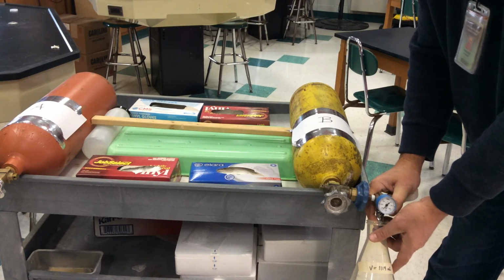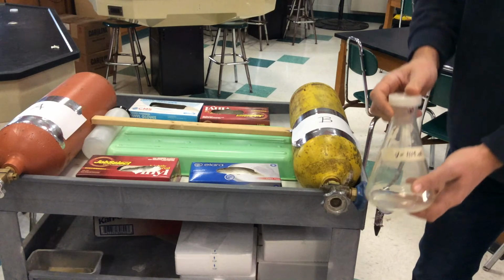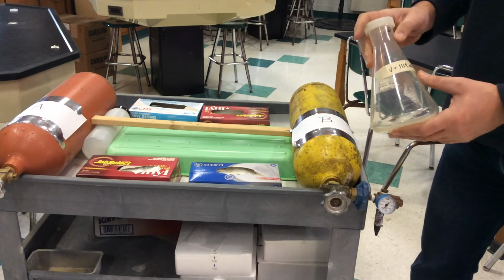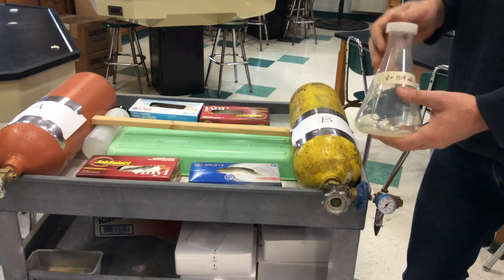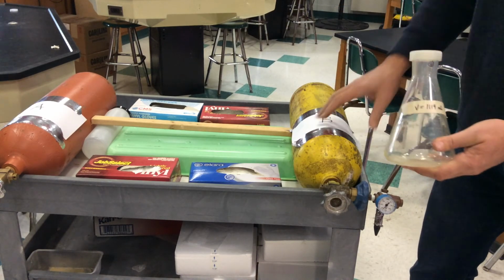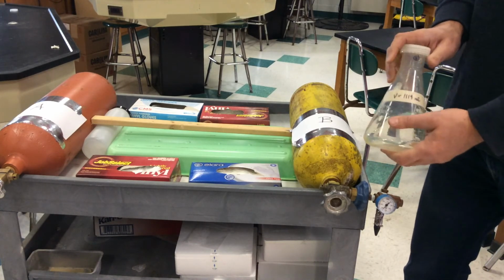And I guess that's about good. And now I'm going to immediately put the top back on, and now I'm going to mass this out. Now I have a flask full of gas B, and I would mass it out. And of course, I'd be subtracting out the empty flask that we get using our density equation for air to continue on the lab. So that's important that you fill these gases appropriately to do the lab. If not, you will not get any kind of data that makes any sense. All right, good luck.